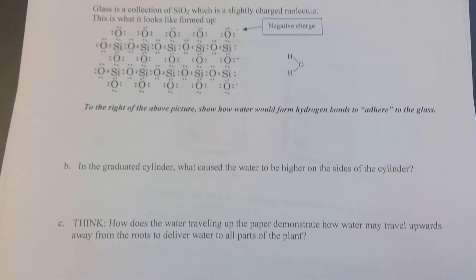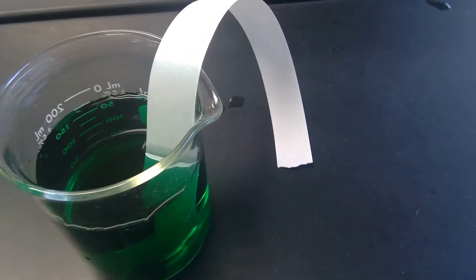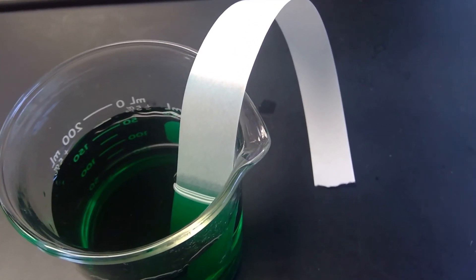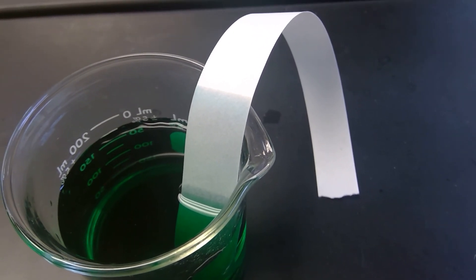And then the last part has to do with water traveling up paper. So let's take a look at what happened with our water traveling up the paper. You'll see it's now moved up quite a bit from where it was to begin with, and it's continually moving up slowly.